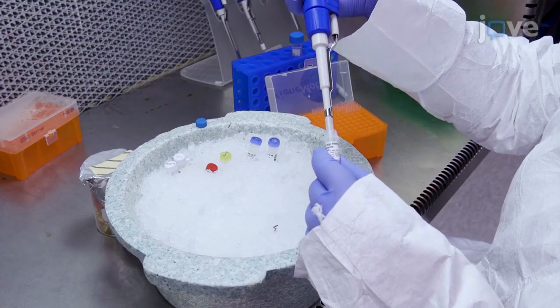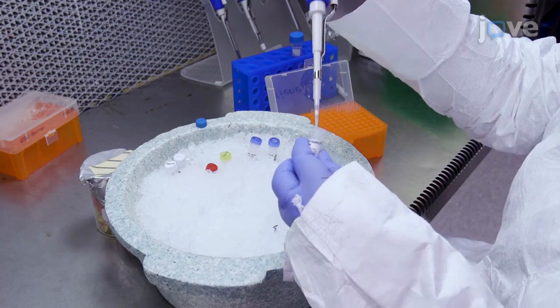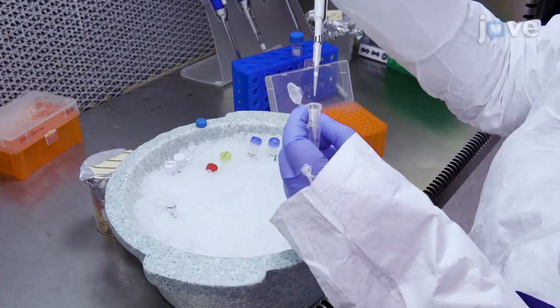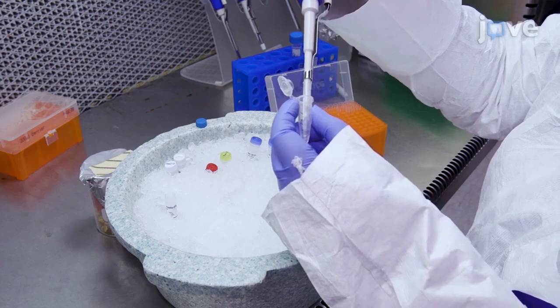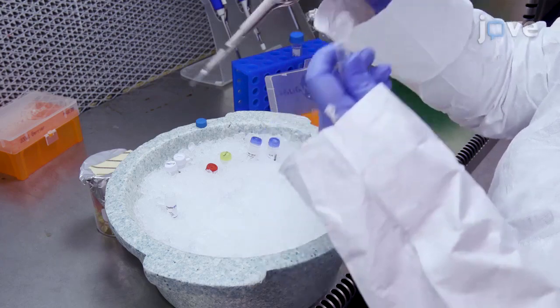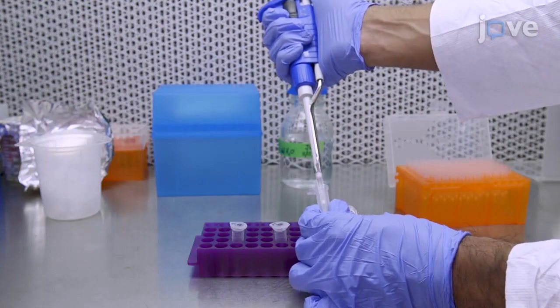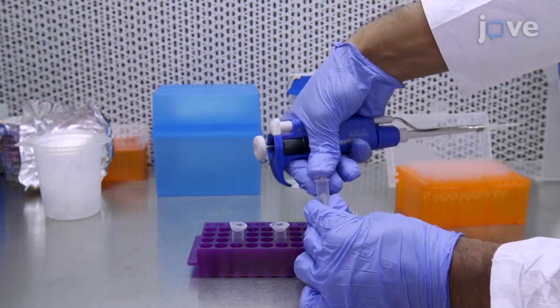There have been many genetic screens that have identified genes that both shorten and extend lifespan. These include studies in the budding yeast, Saccharomyces cerevisiae, which is the focus of this methodology, as well as more complex multicellular organisms like C. elegans and the murine model system.